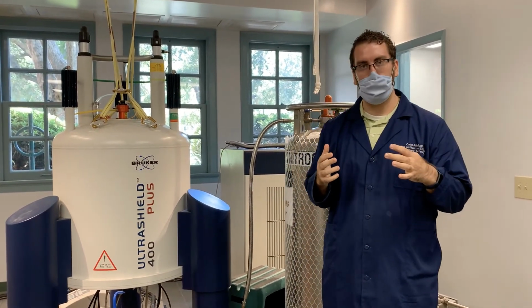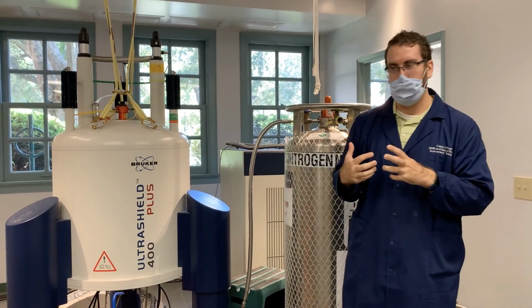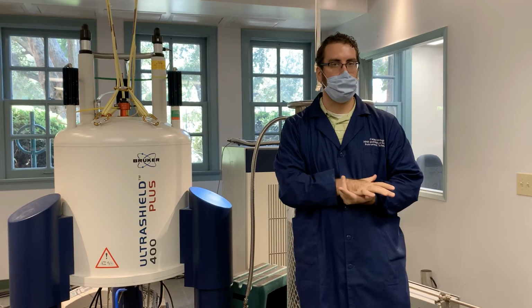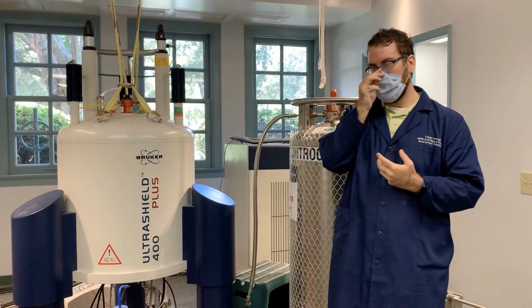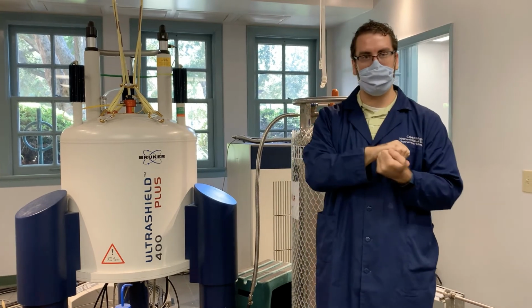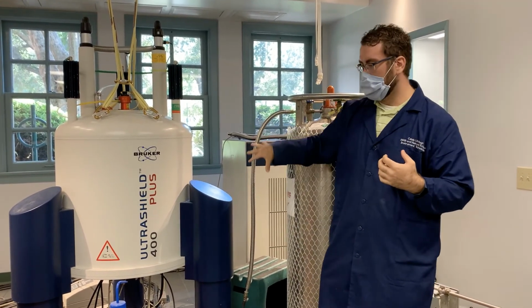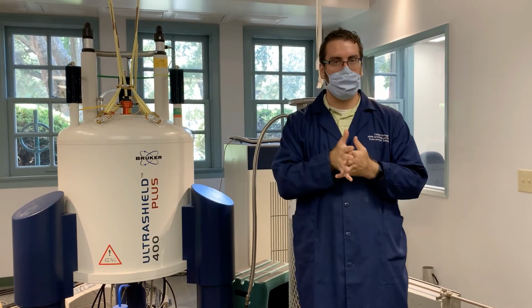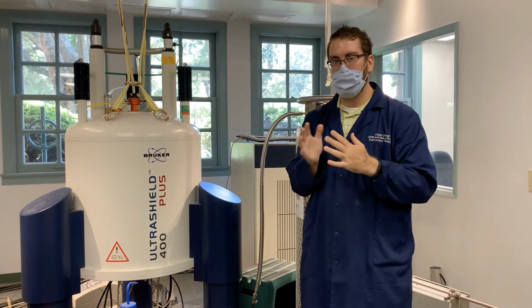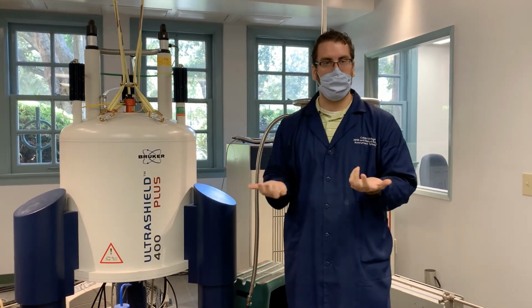Then, so that kind of covers what we mean by the magnet. Let's move back to the resonance and the nuclear part. So I said that we look at the nucleus of molecules. And how we do that is we use this magnet and we tune it to a frequency. And that frequency is a resonance frequency for different atoms.